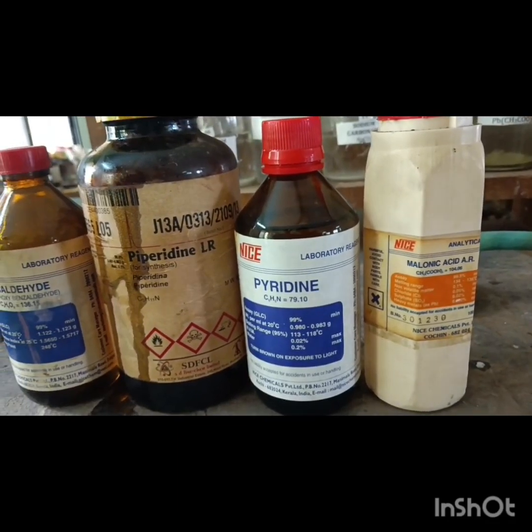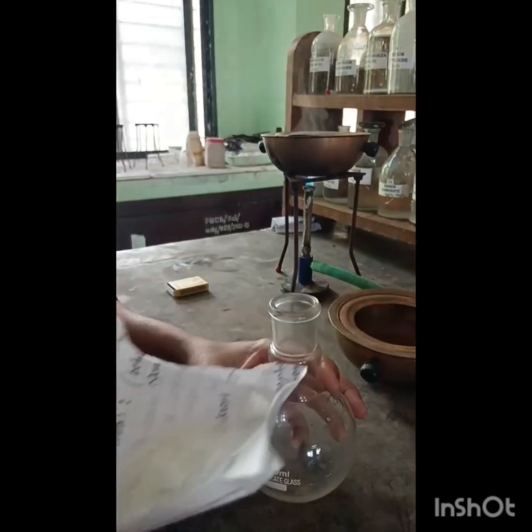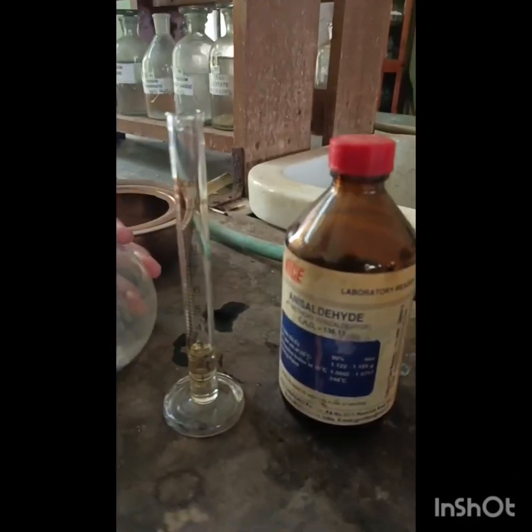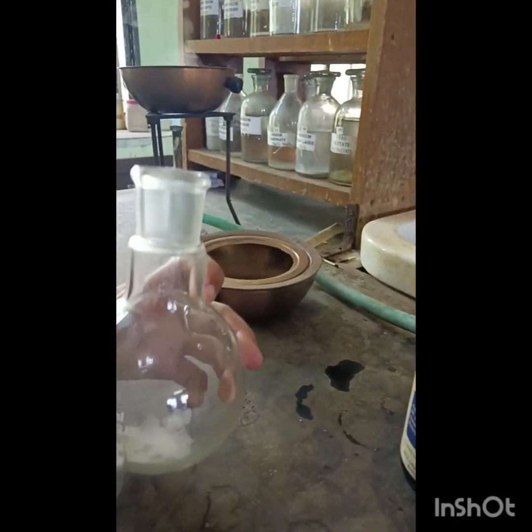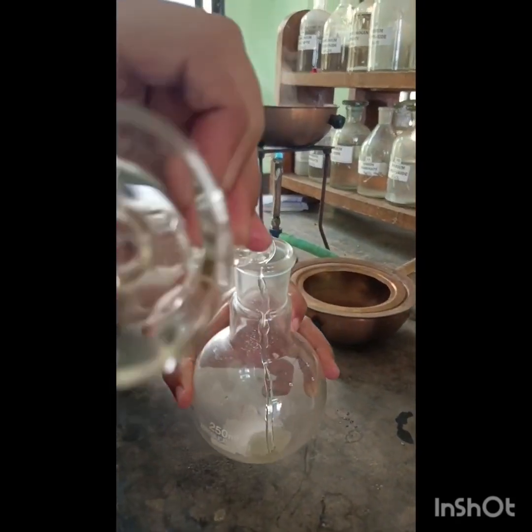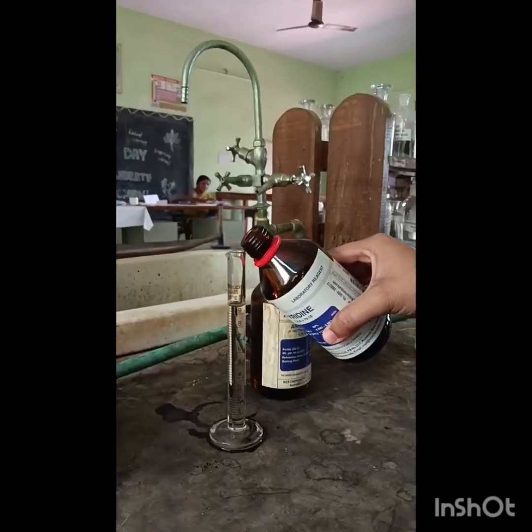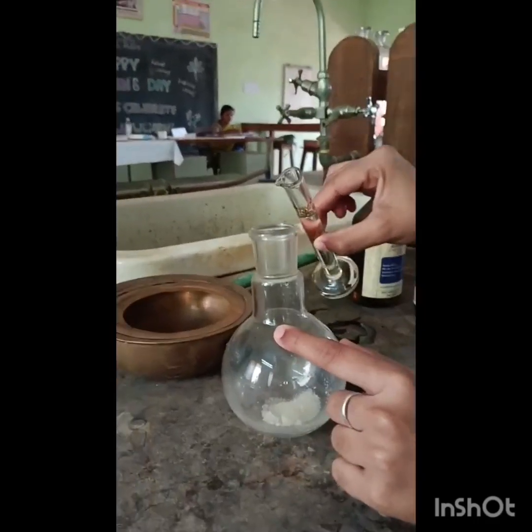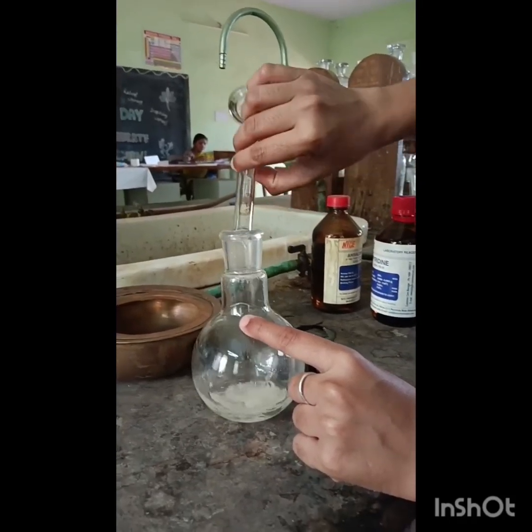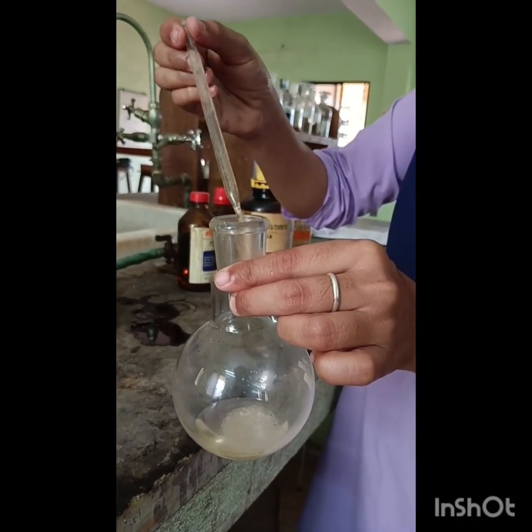Now the procedure of the experiment: take 6.25 grams of malonic acid in a round bottom flask. Add 2.7 ml of anisaldehyde to the malonic acid. Measure 10 ml of pyridine and add to the same round bottom flask. In the same round bottom flask, add a few drops of piperidine.